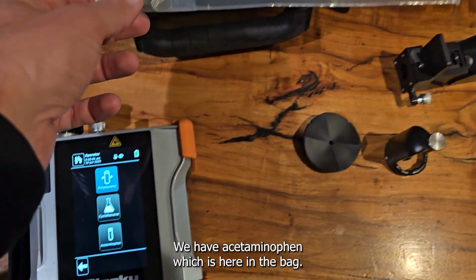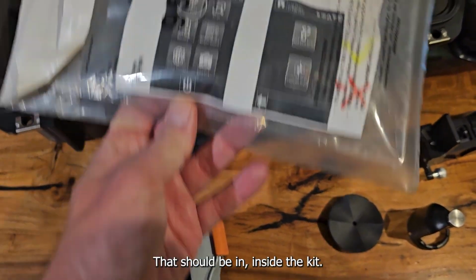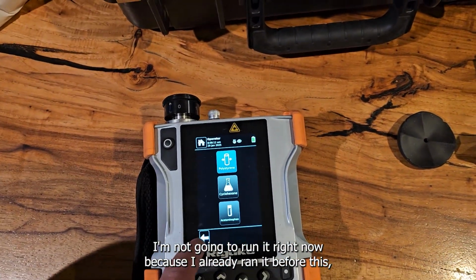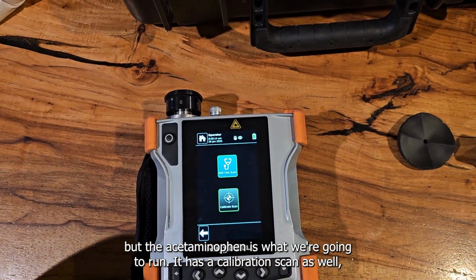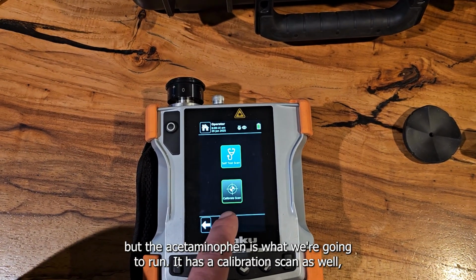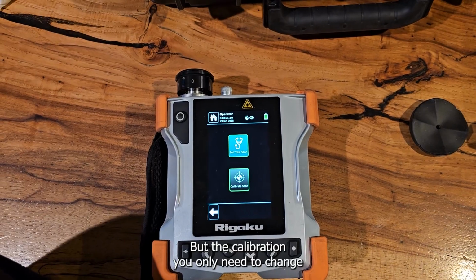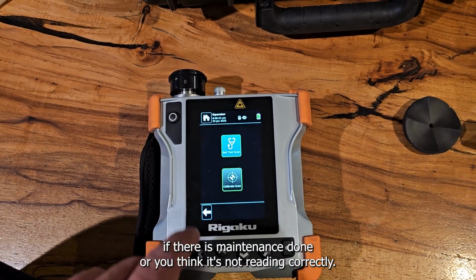We have acetaminophen, which is here in the bag that should be inside the kit. I'm not going to run it right now because I already ran it before this, but the acetaminophen is what we're going to run. It has a calibration scan as well, and we have the vial for that in there as well. But the calibration you only need to change if there was maintenance done or you think it's not reading correctly.